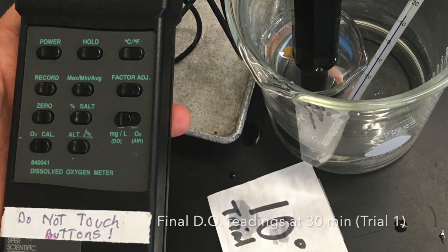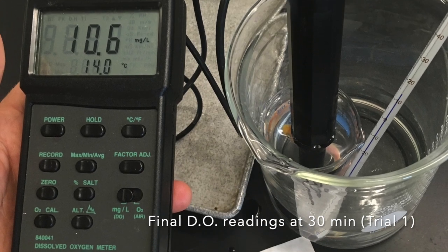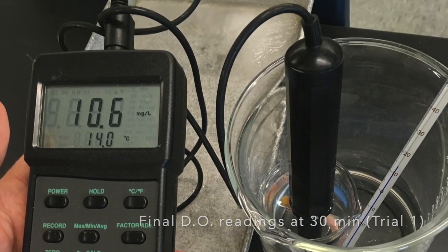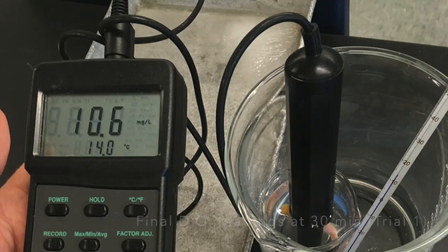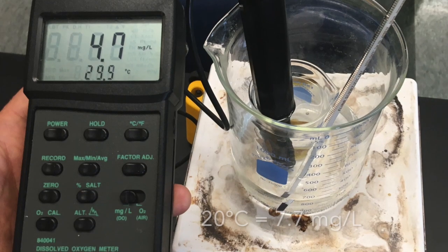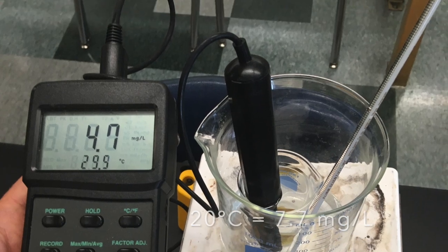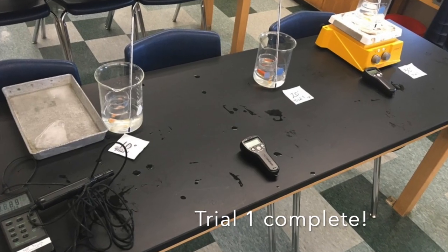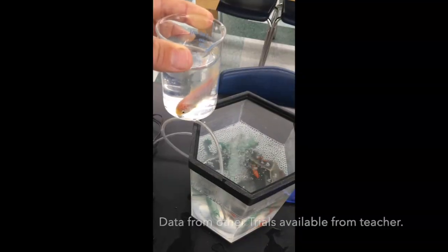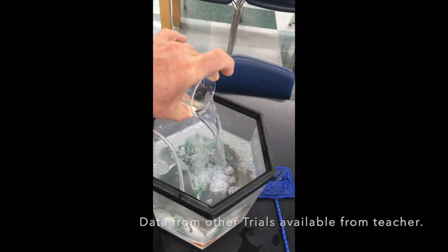Finally, you can record the final dissolved oxygen for each treatment: 10.6 at 10 degrees Celsius, 7.7 at 20 degrees Celsius, and 4.7 at 30 degrees Celsius. No fish were harmed in the making of this lab.